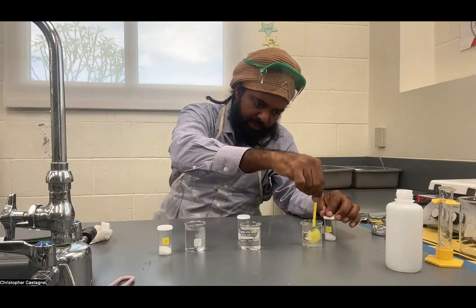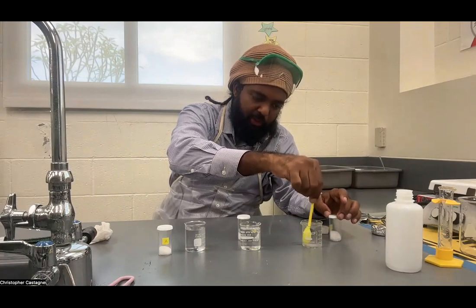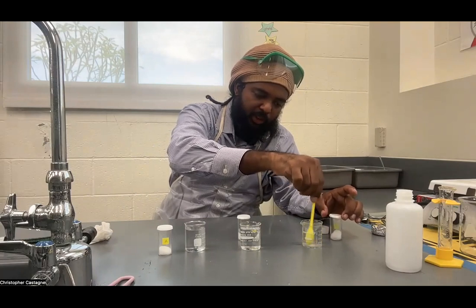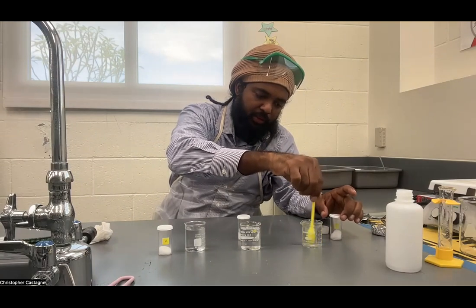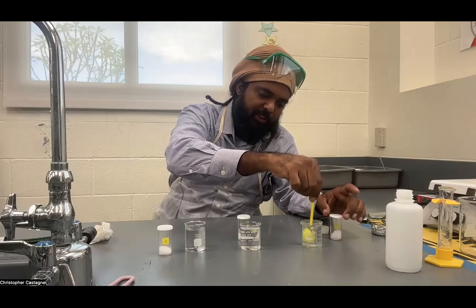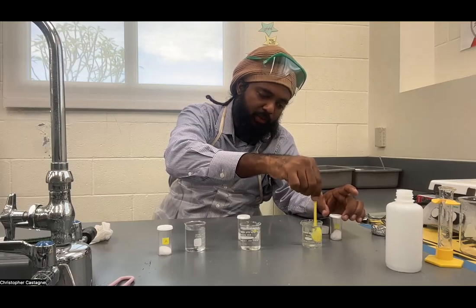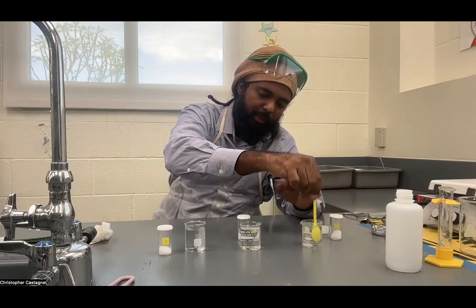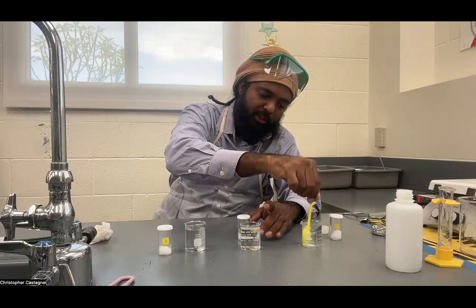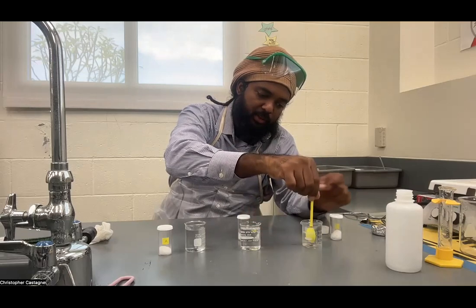The last test is a test for conductivity in solution. There's one type of substance that can conduct electricity when dissolved in water. One type of substance does not even dissolve in water — B did not dissolve, so we're not going to expect it to conduct electricity. We're still going to test it, though. For this third test, we're going to use the conductivity meter.